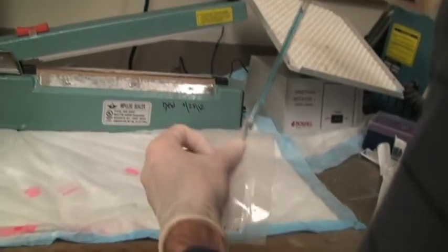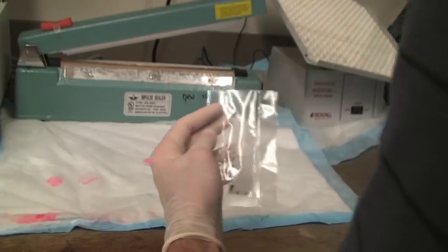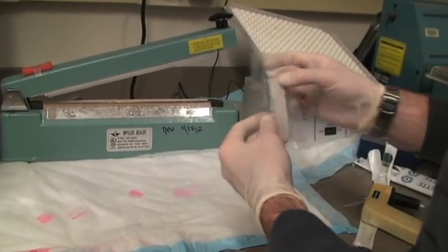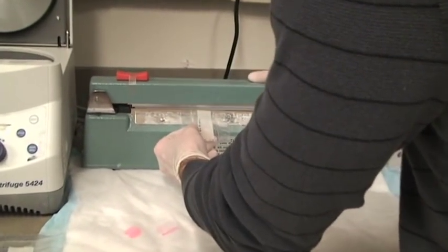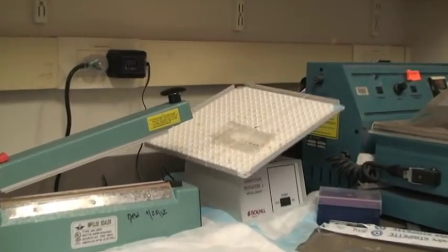Here Larry is pipetting his antibody into the little plastic baggie. He's going to make sure that the whole membrane is wet and saturated in the antibody solution, and then he's going to seal the top.